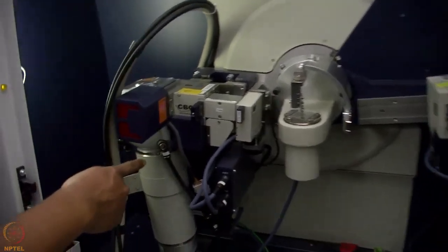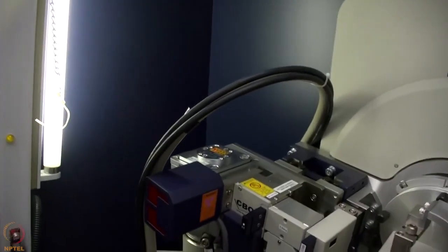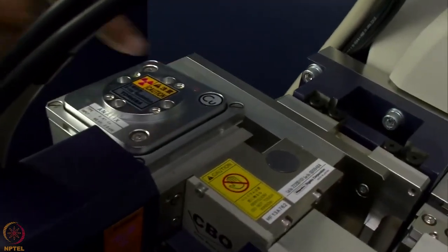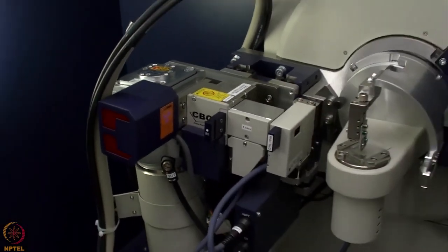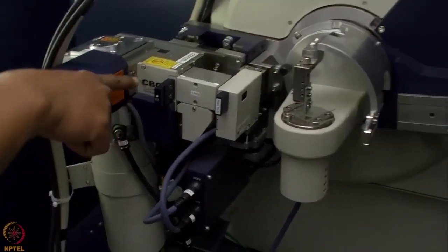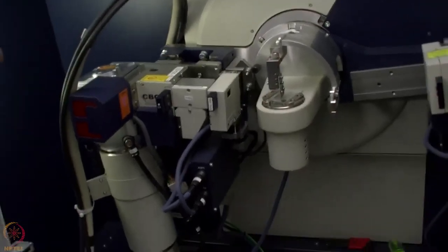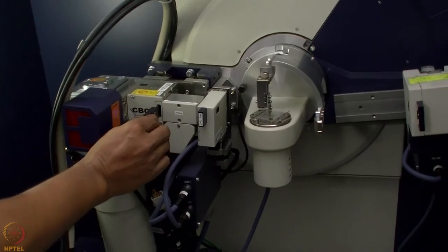On the left hand side here, we have the X-ray tube mounted. This is mounted from top, and you can probably see that this is a copper based X-ray source, which is written here as copper. So the tube is giving you copper K alpha and K beta radiation out of it. So when the beam comes out, this is the optics where it is called the cross beam optics. It then makes the beam in a linear fashion, and then we have some slits here.